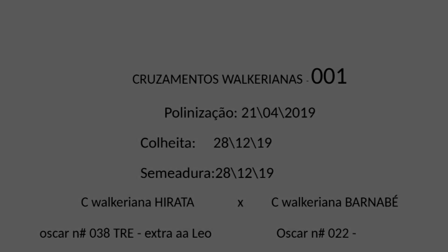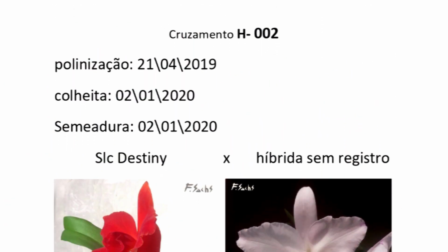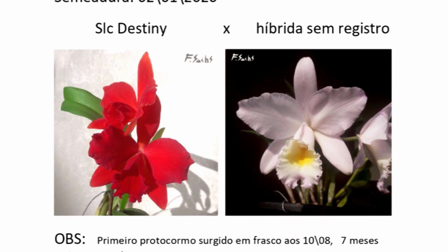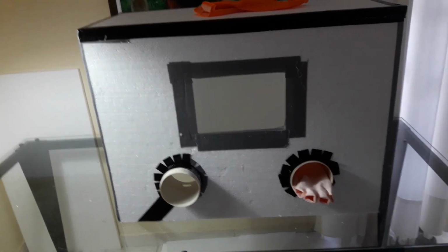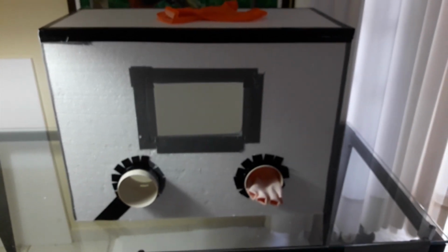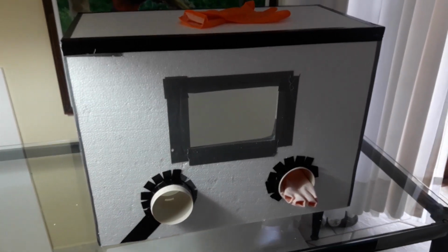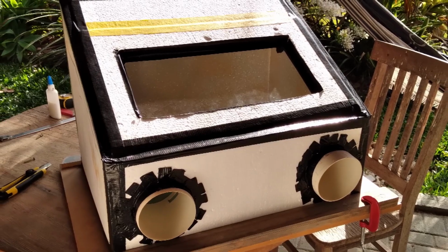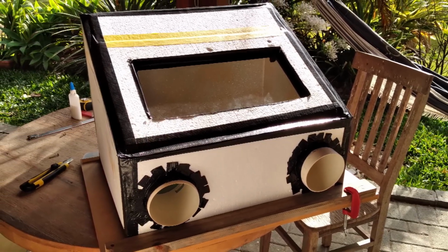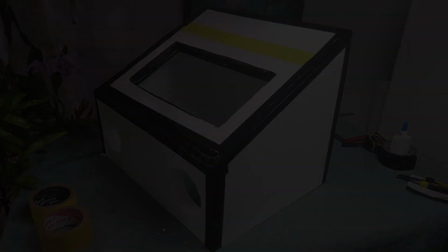Okay then, bad news first. My first crossings, number 1 and number 2, were a total failure. More than half of the jars were contaminated with molds. Back then, I was using my first model of glove box, which had a few problems. The walls were too flexible, and that produced a sort of a bellows effect, pulling air in from the outside as I manipulated the objects inside. To fix that, in the model I showed you in episode 4, I used double layered walls and the top at an angle, making the whole setup much more rigid.